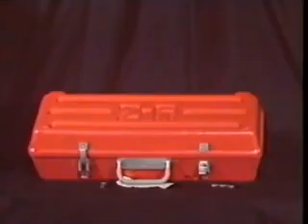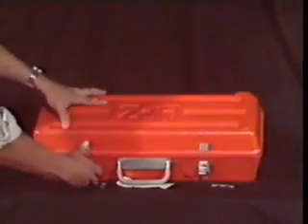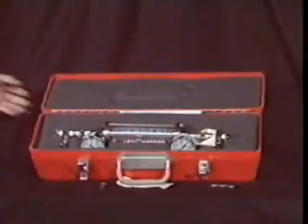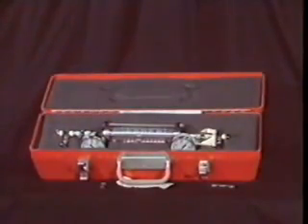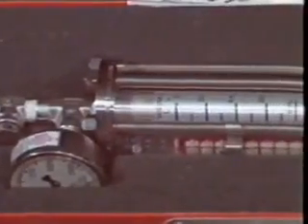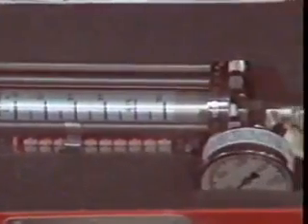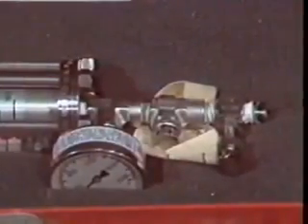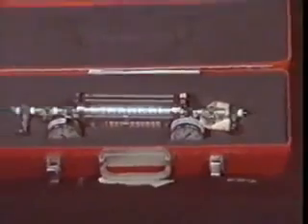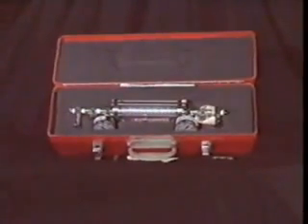Finally, all sample cylinders must be in a container that will protect both the valves and the cylinder from damage or loss of the sample when it is transported. This is a requirement of the Department of Transportation. The sample should also be accompanied by a properly completed Department of Transportation shipping form. Remember, improper transportation is a safety hazard as well as a violation of the law.